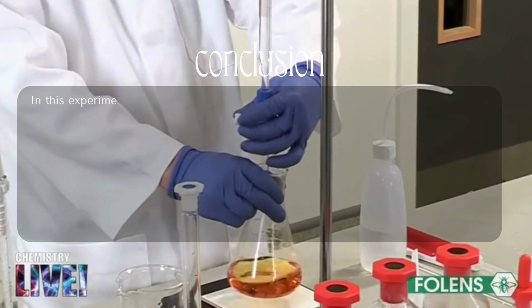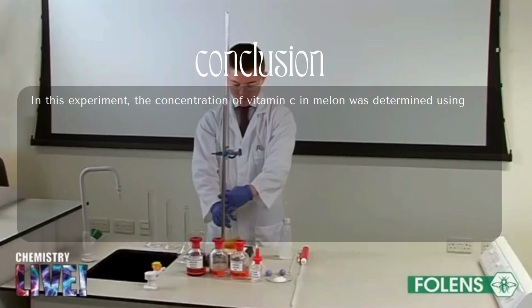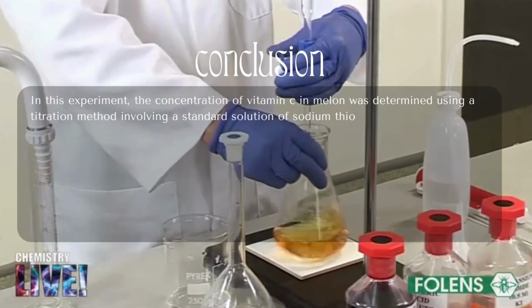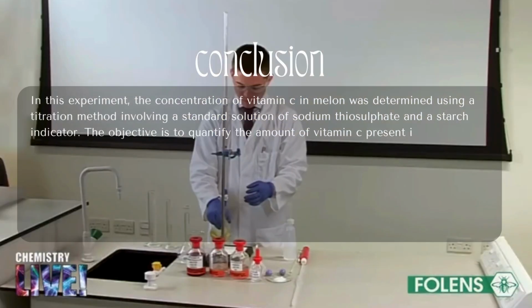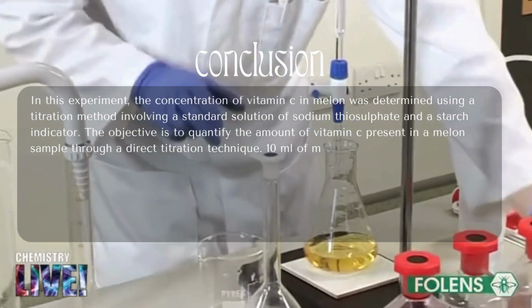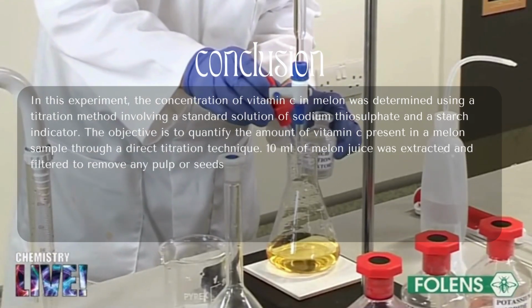In this experiment, the concentration of vitamin C in melon was determined using a titration method involving a standard solution of sodium thiosulfate and a starch indicator. The objective is to quantify the amount of vitamin C present in a melon sample through a direct titration technique. 10 ml of melon juice was extracted and filtered to remove any seeds.